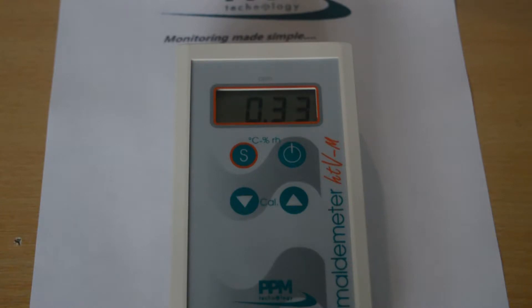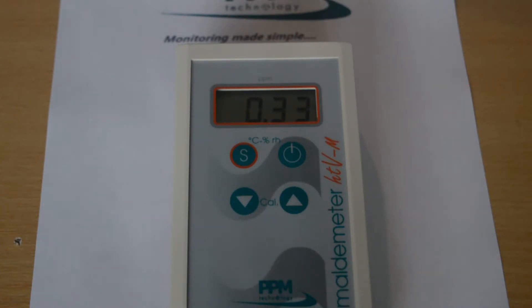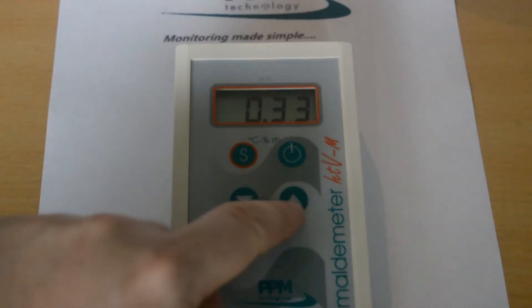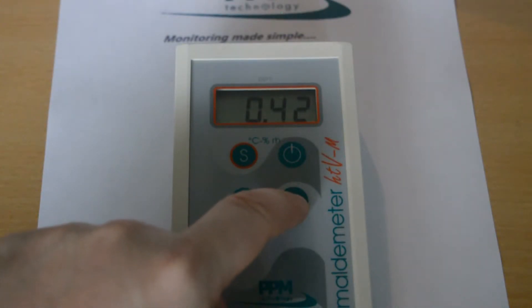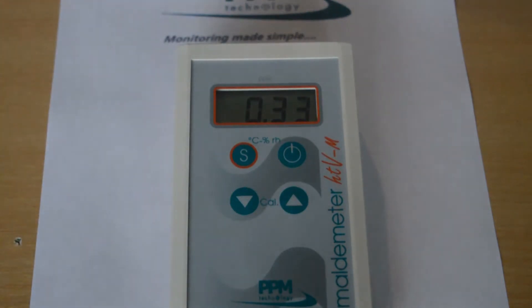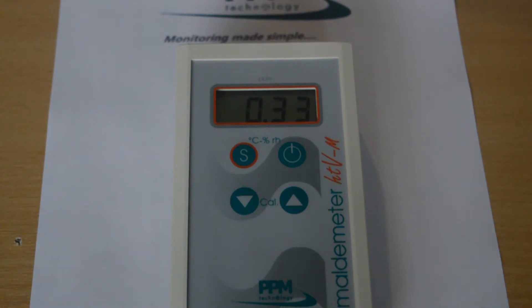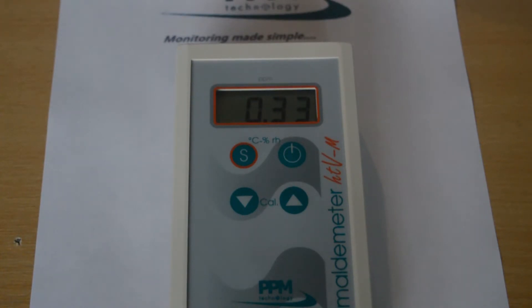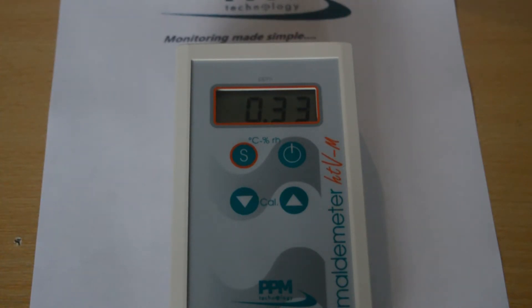You can also see your reading in milligrams per cubic meter by pressing the up arrow button. You will notice that the 'ALT =' message pops up from time to time. However, by pressing the down arrow button, the instrument will show you the time taken for the concentration to be analysed.